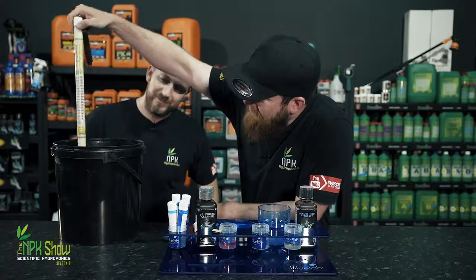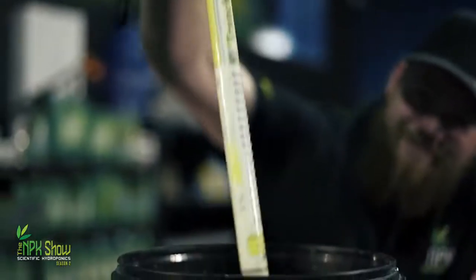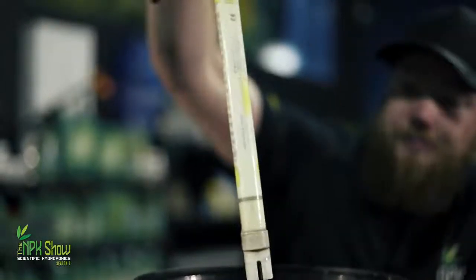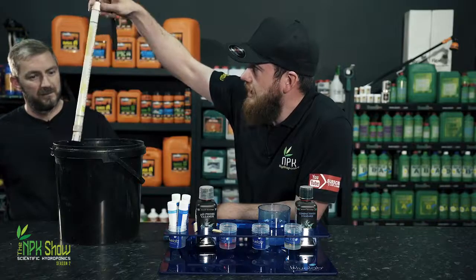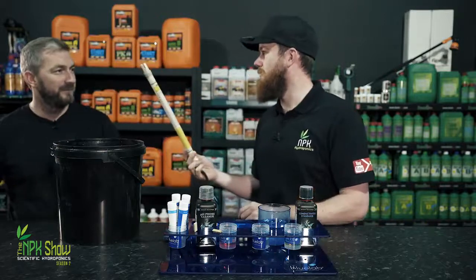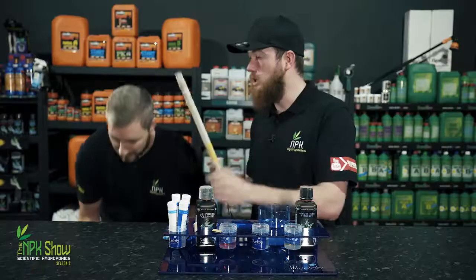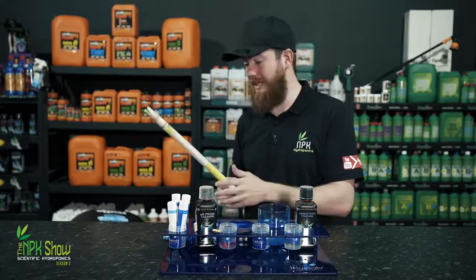20 years later, look at it. It's still going strong. That's what you get when you buy Bluelab. Strong, reliable pieces of kit that can last up to 20 years. I honestly reckon they'd buy that back. I don't reckon Bluelab have got one of them. Don't you think? It's been really well looked after as well. So, how do you look after your Bluelab EC truncheon?